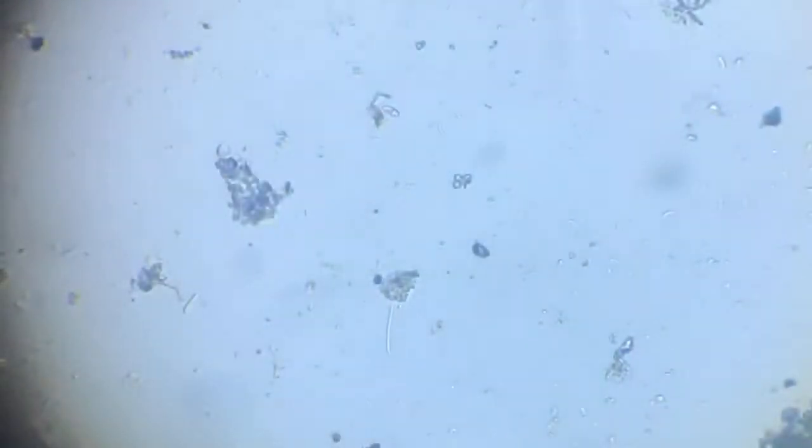Okay, so here. What I do is I bring the mobile camera in a kind of a focus with the microscope lens system, and once I find this coherence, then I zoom in. Gives me a higher degree of zooming. Did you see that?